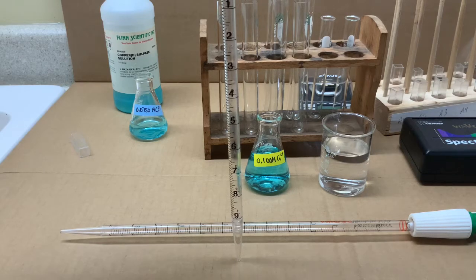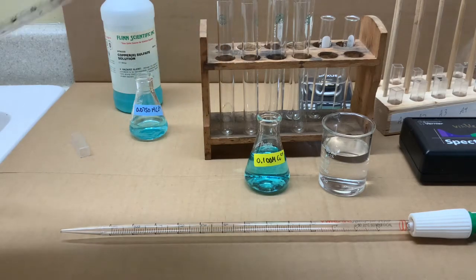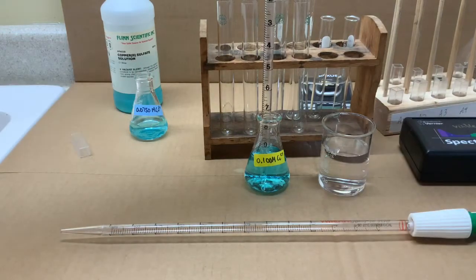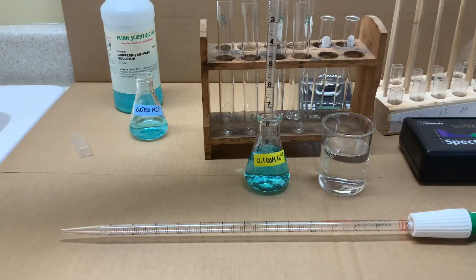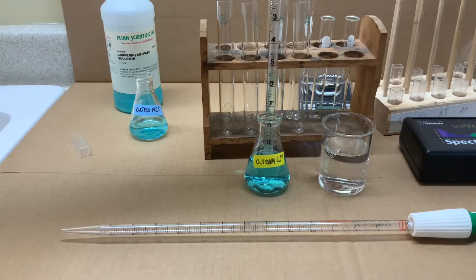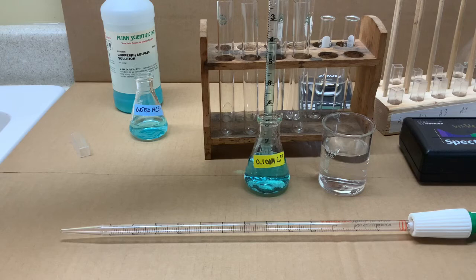Graduated pipettes will be used. Notice that they need to have the pipette pump on tightly, and we'll put the graduated pipette into the stock solution and draw up the appropriate amount.